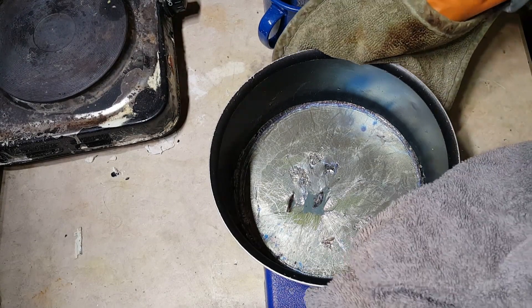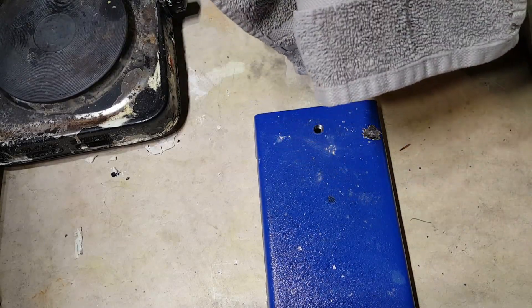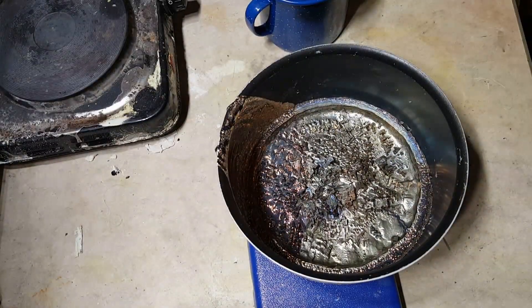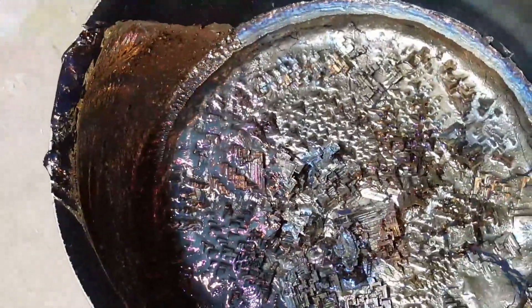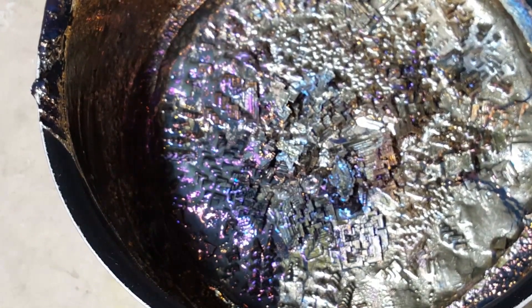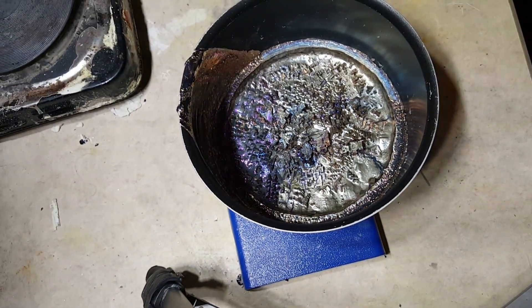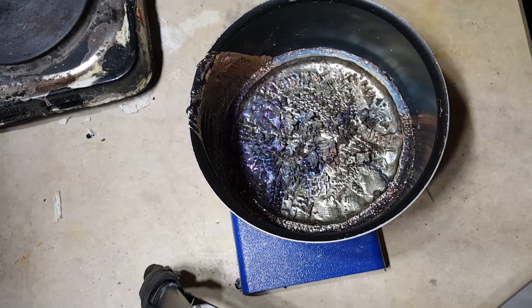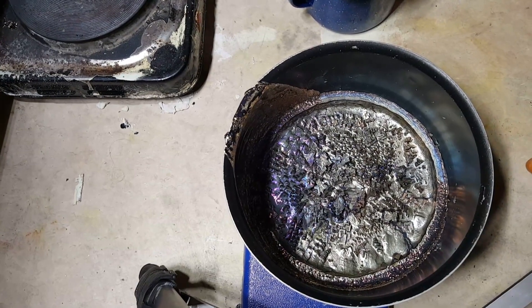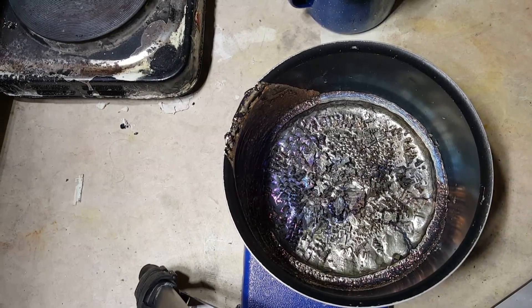It's still very hot, of course, so you want to use oven mitts. And the result is these really, really nice, big, complex crystals on the bottom here. They'll quickly coat themselves in the characteristic rainbow oxide layer. This definitely took quite a bit of trial and error on my part to figure out just the right amount of time to cool the bismuth without the rest of it freezing around the crystals.